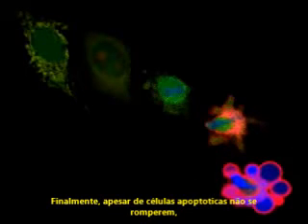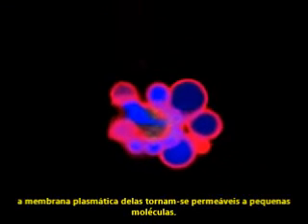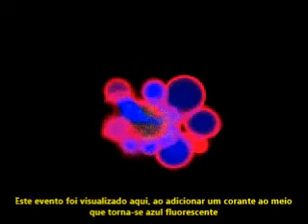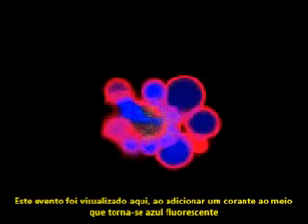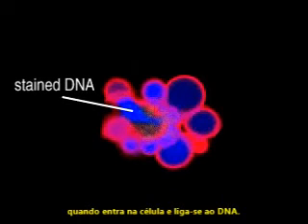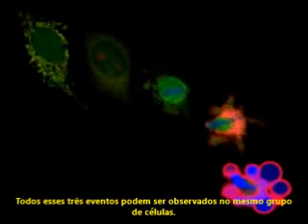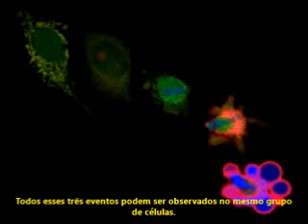Finally, although apoptosing cells don't lyse, their plasma membranes do become permeable to small molecules. This event has been visualized here by adding a dye to the media that fluoresces blue when it can enter cells and bind to DNA. All three of these events can be observed in the same group of cells.